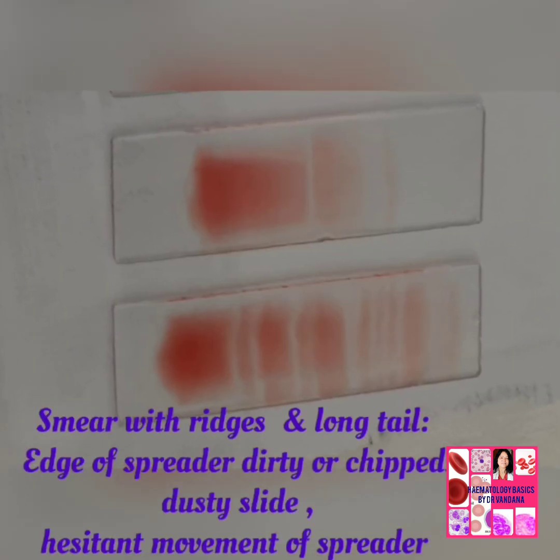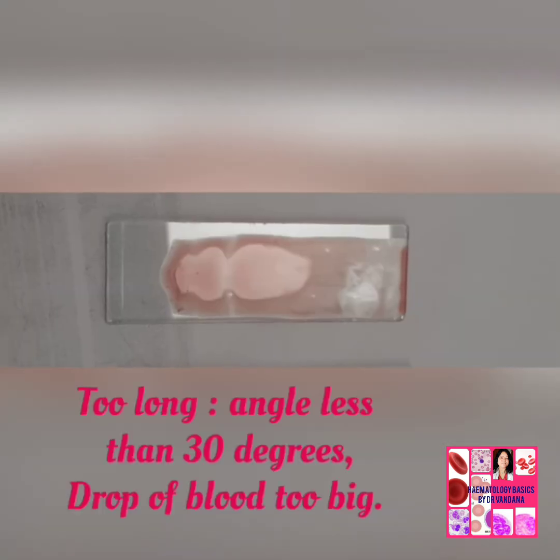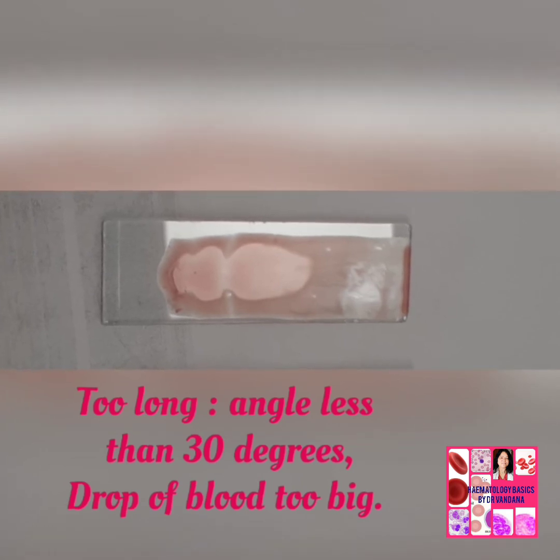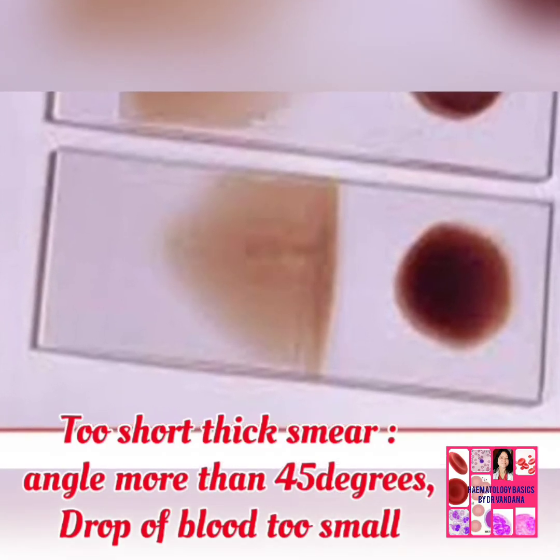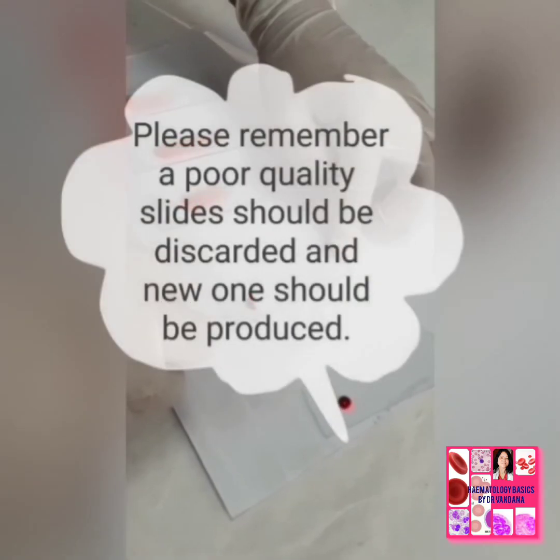And this is a smear with ridges and long tail. Hesitant movement of spreader has been done. And this is too long, angle less than 30 degrees, drop of blood too big. The smear with gaps, greasy slide. This is too short thick smear, angle more than 45 degrees, drop of blood too small.